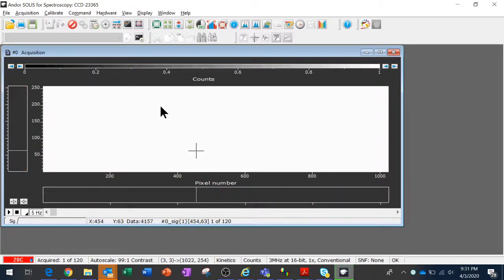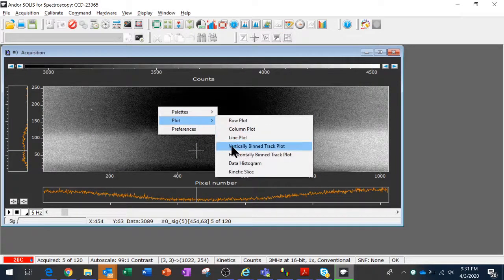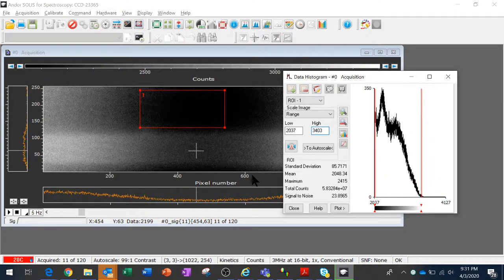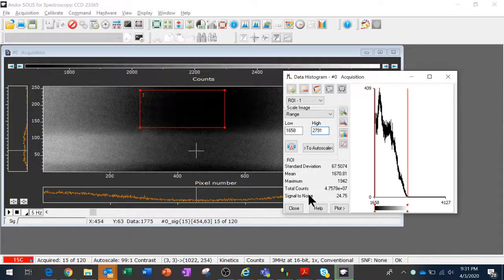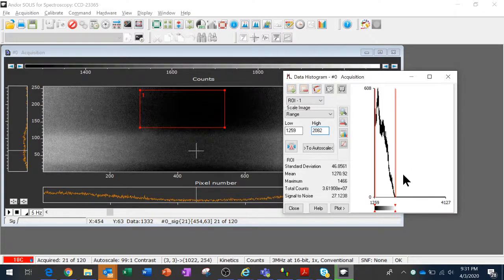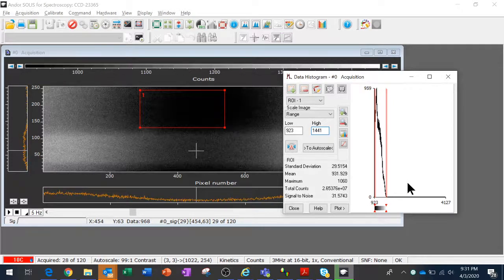To track it statistically, I'm going to open up a histogram. I can right-click on the plot window and show a data histogram. I've got an ROI tracking right now, so you can see statistics updating here in the ROI. And you can see as the camera cools, and you can see the temperature reflected here, the histogram of dark counts, of dark current, is going to get dramatically shrunken towards 0. I'm going to have to zoom in a few times for you because it's going to collapse onto the left axis there.